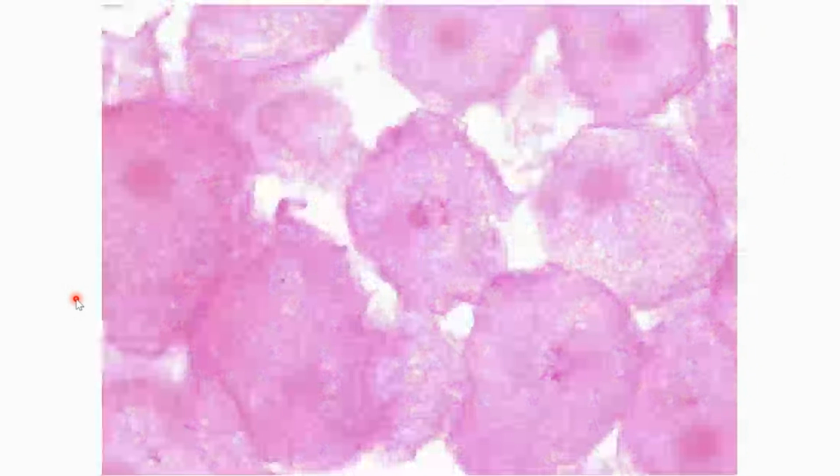Up over here, notice how this cell has some clumpy DNA inside of it. This would be a cell that we would say is in prophase. This one over here, I would probably say is an interphase cell because that genetic information isn't distinctly clumped like I see over here, but it's all kind of fuzzy in an area together. So that could be potentially a prophase or an interphase cell, excuse me.